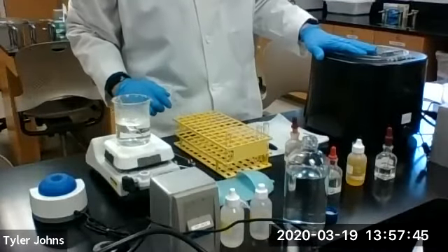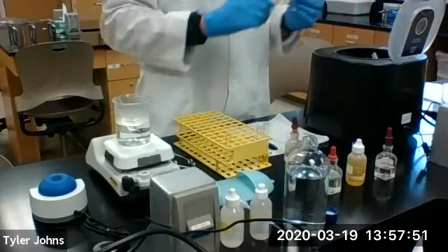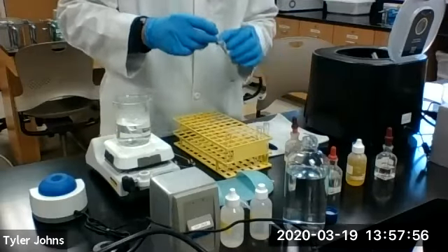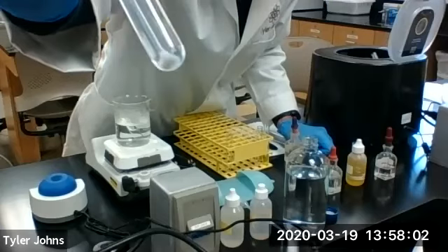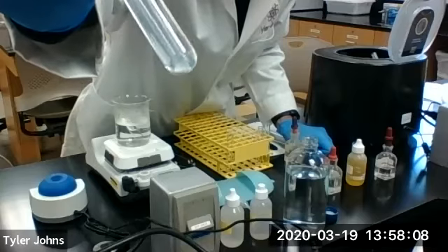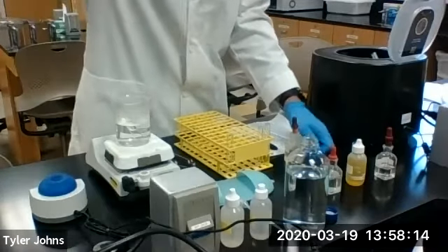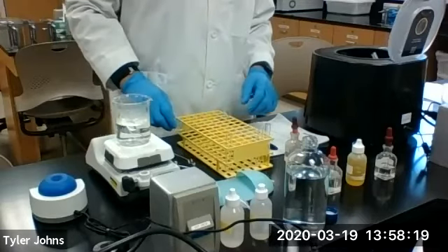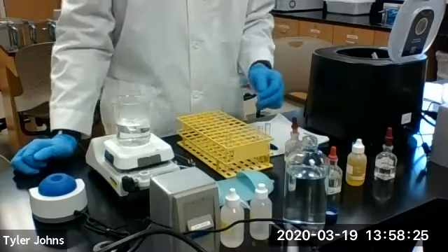Okay, so at this point, our centrifuge is stopped again. We're going to remove our test tube containing the S3 solution that we had acidified with 6 molar nitric acid. As you can see, we now have precipitated. We have a nice white precipitate. That white precipitate is a confirmation of the silver ion. All right, at this point, that concludes the test for the group 1 chloride group ions. You'll now continue on to the group 2 ions.